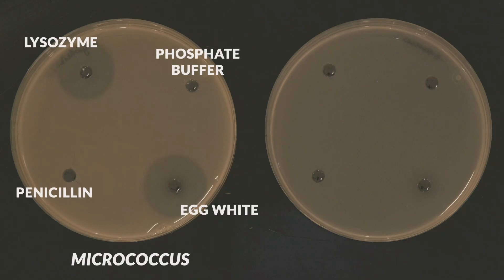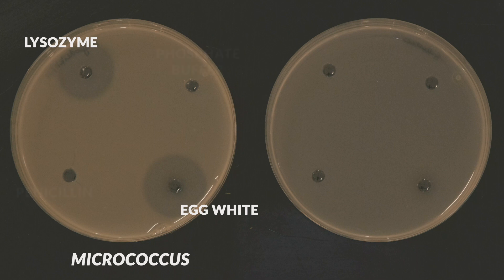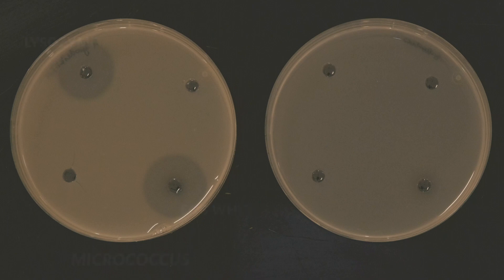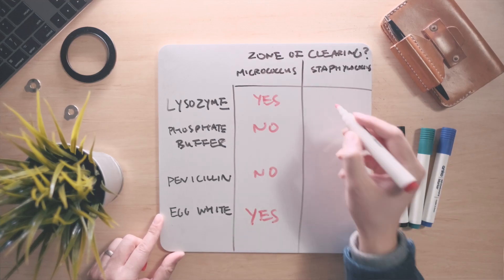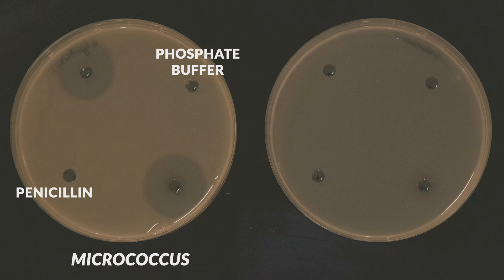Let's look at the results for Micrococcus first. We see zones of clearance for Purified Hen Egg Lysozyme as well as Egg White, which is enriched in lysozyme. This makes sense, as the lysozyme present in these solutions can break down the peptidoglycan found in the cell wall components embedded throughout the agar. We do not see zones of clearance for Phosphate Buffer, which does not contain lysozyme, or for penicillin.